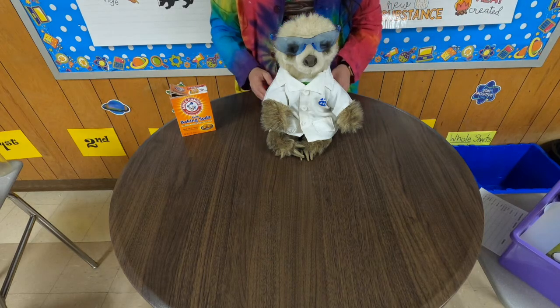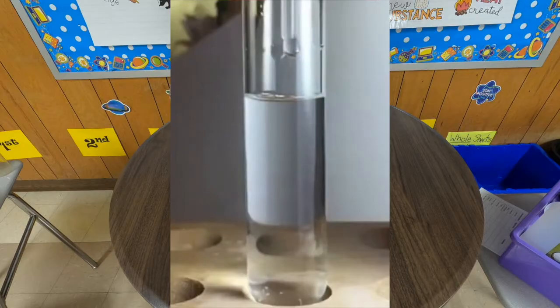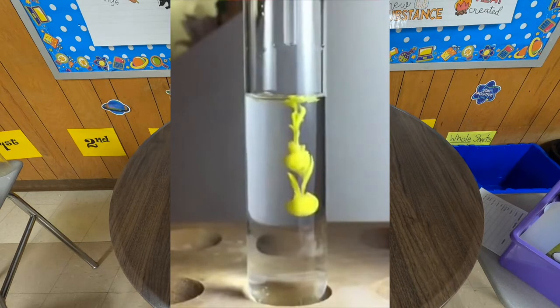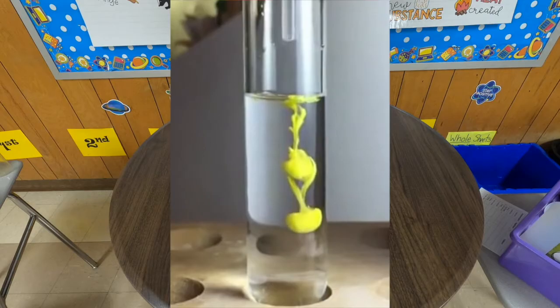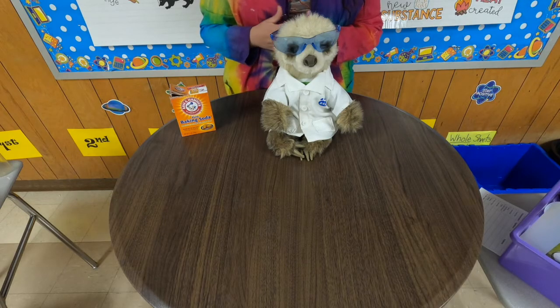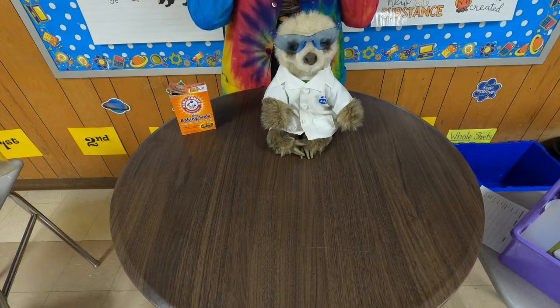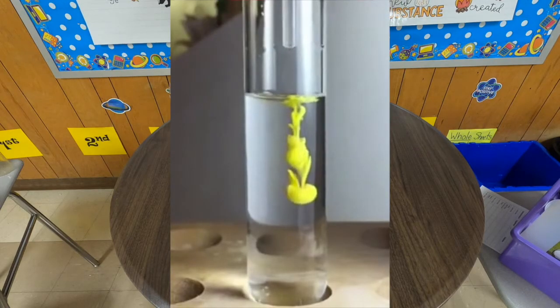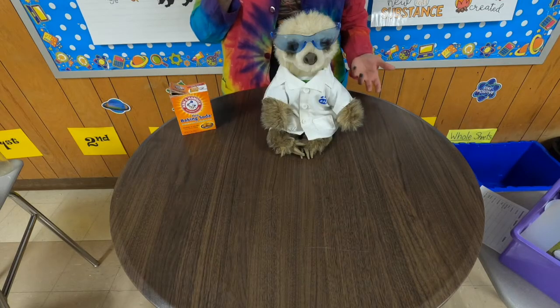The next demonstration that I'm going to show you is actually going to be a video that I'm going to insert here. And it is a lead iodide reaction. So lead iodide, you're mixing two clear liquids, and then there is an unexpected color change. So is this a chemical change or a physical change? Lead iodide is a chemical change because it is an example of a precipitate forming. You'll notice that the yellow precipitate is falling to the bottom of the test tube, and that's because it's more dense. It's a solid, which is a precipitate. A new substance has been formed. There was a chemical reaction.